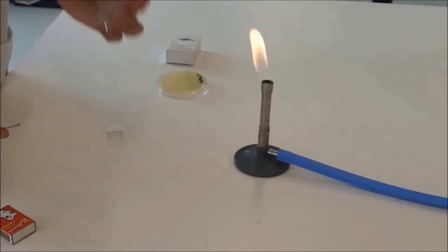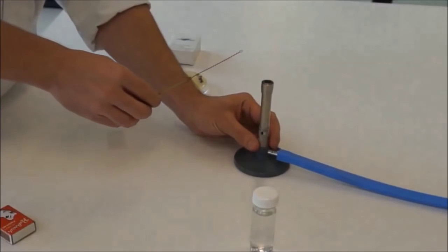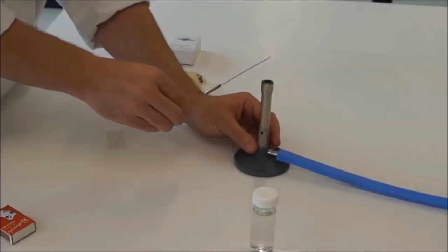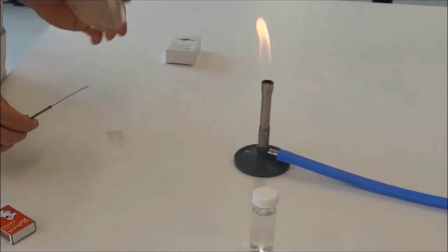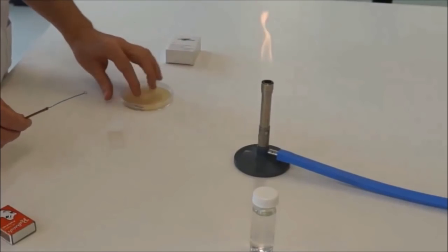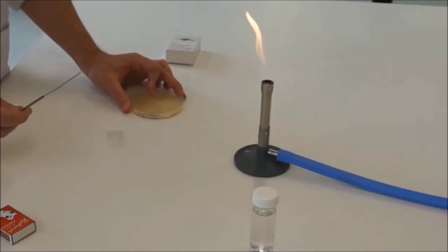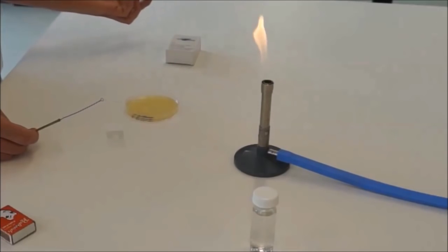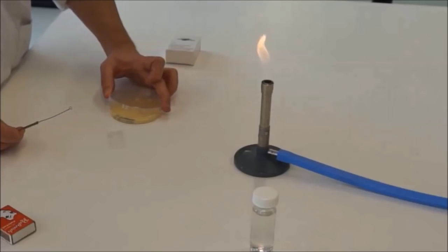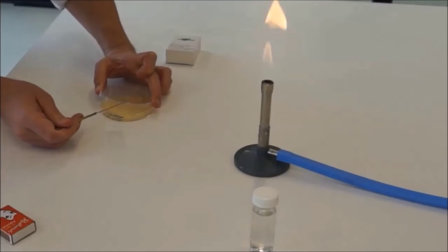Try not to talk over your water, because that's probably just contaminated that water. Now you should burn that again, just to make sure you're not transferring any bacteria that could have possibly been in that water. That's very hot, so I'd cool it down on the agar. And to do that, just turn it so the lid faces up. What you should do is protect the bacteria from any contaminants that are in the air by not completely taking the lid off, but just by using it as a shelter and putting your loop inside there.